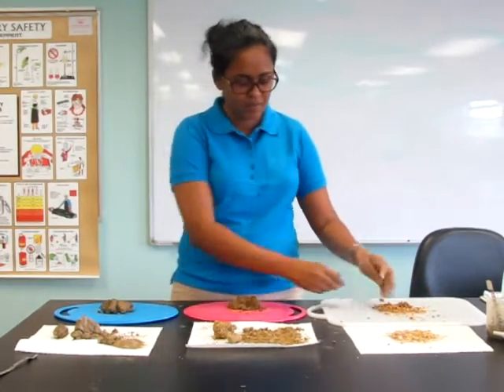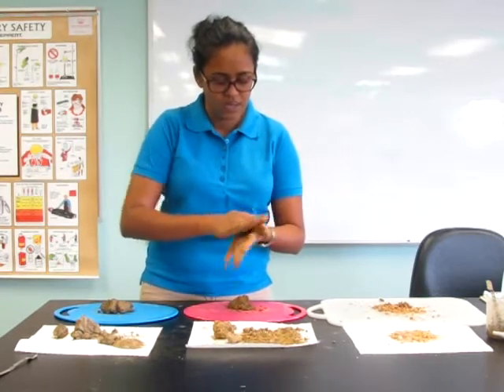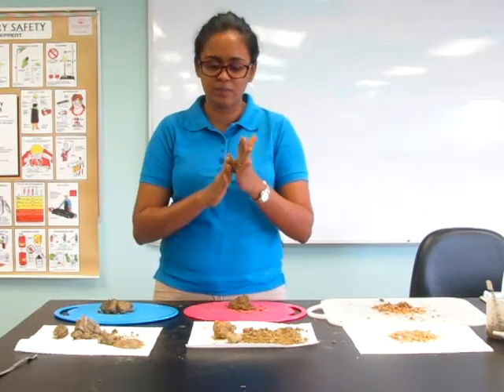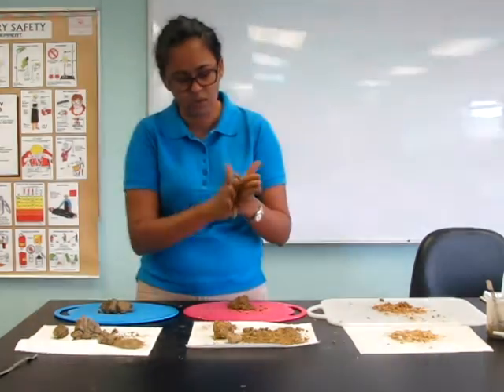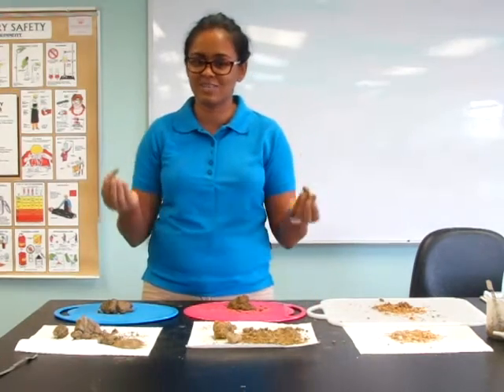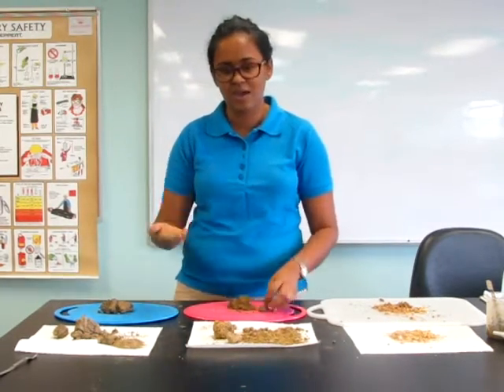In soil sample B, we moisten our soil and now we are going to roll it into a ball. It goes into the ball — not a totally smooth ball, but a ball nonetheless. Now we will roll it into our ribbon. As we roll it into a ribbon, we can observe that there are cracks forming in the soil, but it does go into the ribbon. We are now going to bend it into a U, but as we can see, the soil has broken apart. This indicates that this is a loamy soil. If it had gone straight into the U without breaking, we could assume it would be a clay soil.